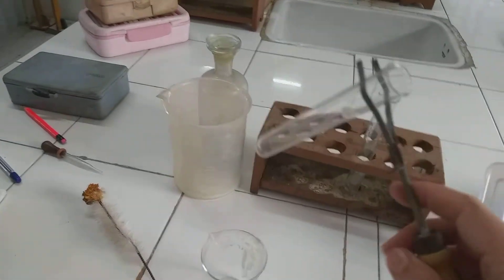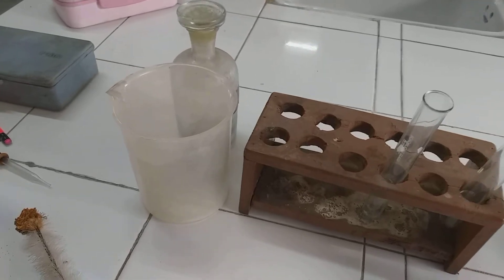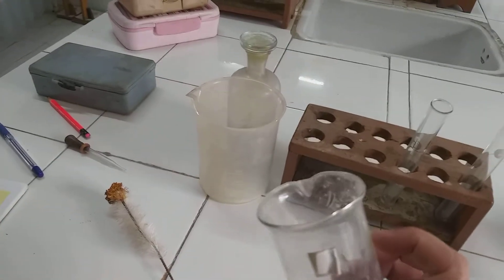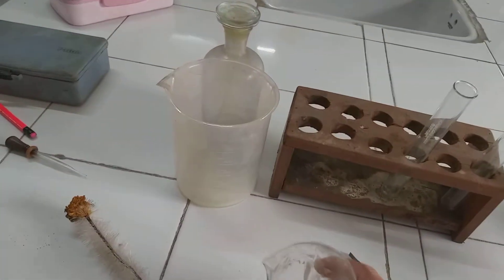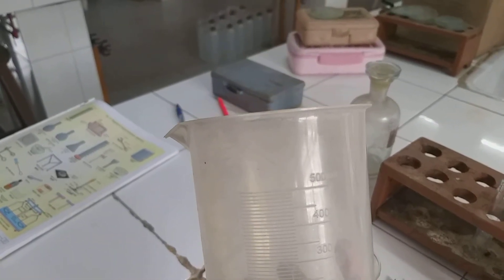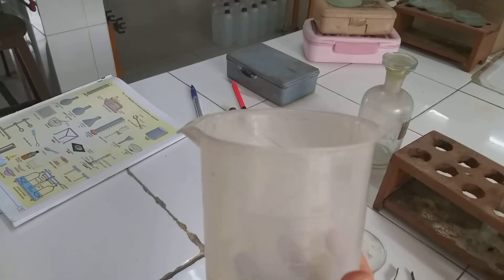This is a beaker. This is a 50 ml capacity beaker, used for keeping liquids. This is another beaker — a bigger one. On this beaker you can see there are various graduations present. It is a graduated beaker: 100 ml, 200, 300, 500 ml.